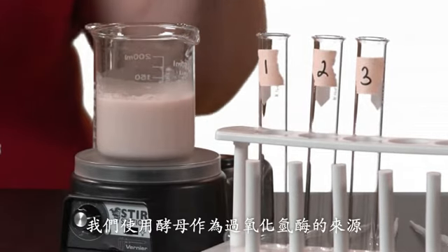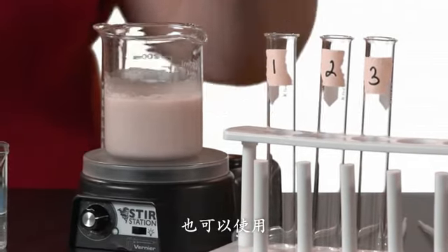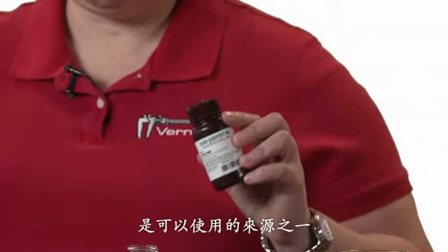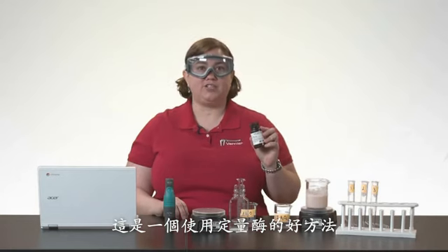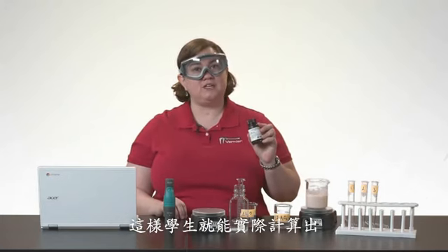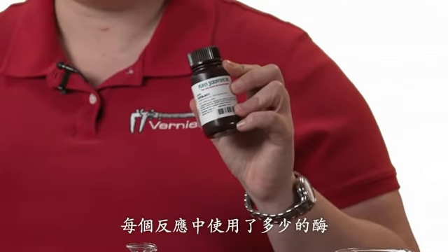We used yeast as our source of catalase, but there are other sources of catalase you can use as well. One of the sources you can use is actually purified catalase that you can purchase from scientific supply companies. This is a great way to actually use a defined amount of the enzyme so students can actually calculate how many units of enzyme are used in each reaction.